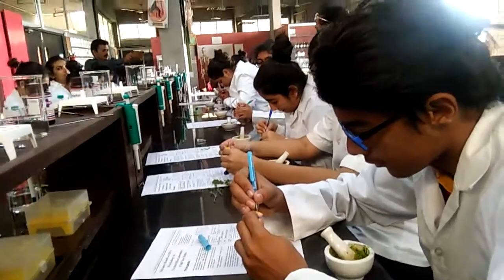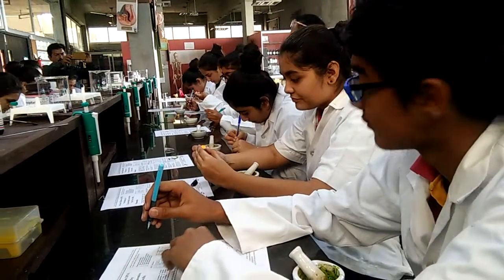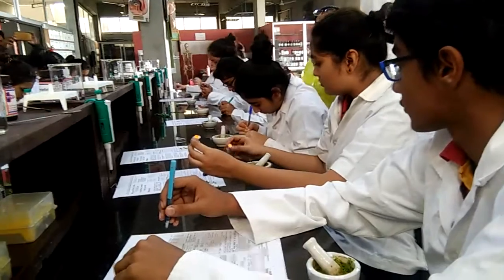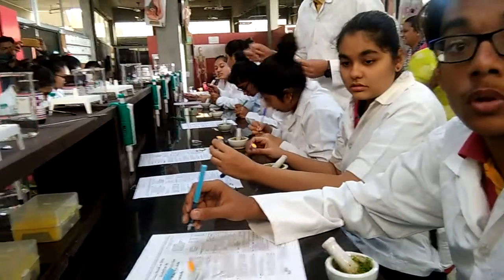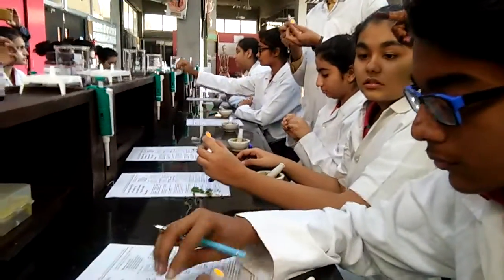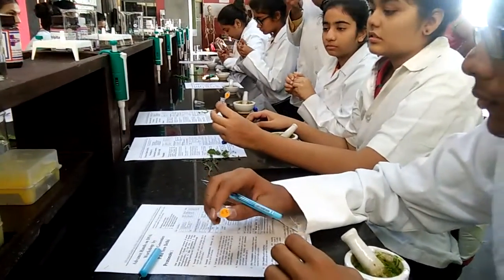Fill up to between 0.1 to 0.5. Spatula is there. Everyone have a spatula. You cannot use pen — any pen you can use, no problem at all.